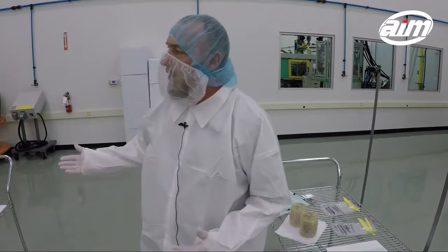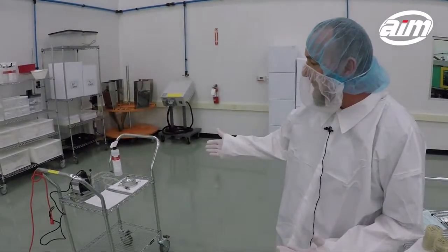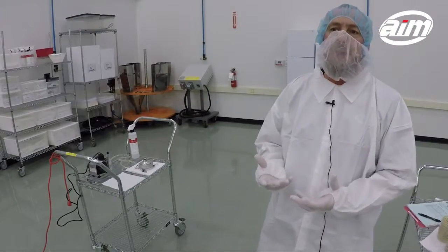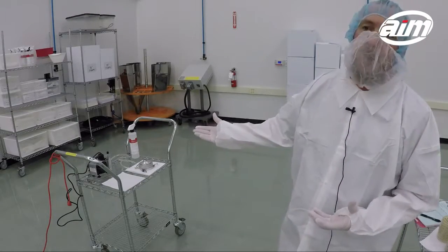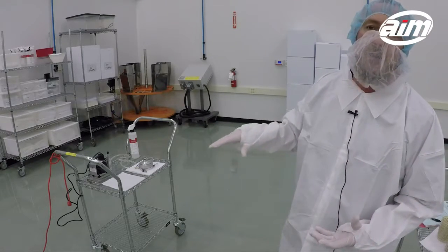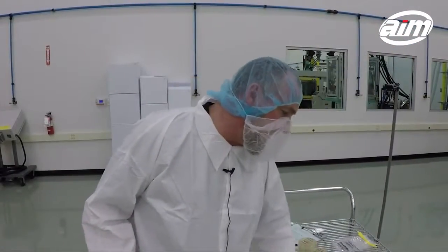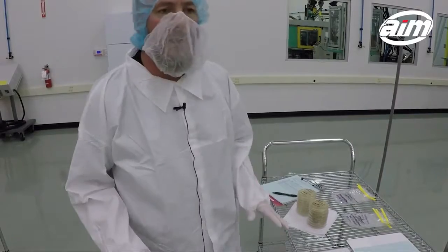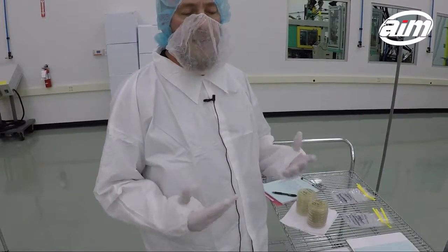What I have here is what they call an impactor, an impact and sampling device. What it does is you put a petri dish with a medium on it in the impactor, and the vacuum pump draws air into the impactor and draws air on top of the agar medium on the plate. I'm going to start with a sample plate for the bacterial sample collection.